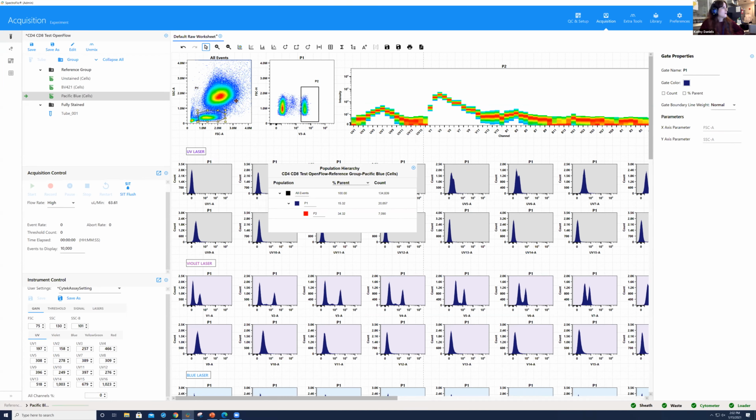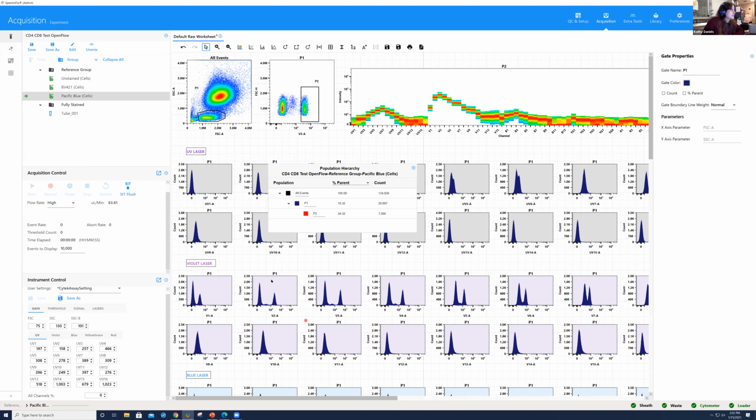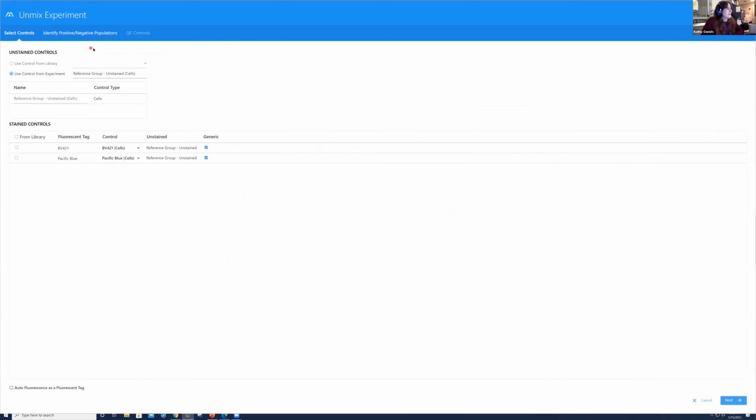Yep. Okay, great. So now that we've gone ahead and recorded these single colors for these two fluors that have a very similar spectral signature, what we're going to do is go ahead and unmix to see if it works. Okay. So we're going to click unmix. Let me go back and do that again in case I did it too quickly. So I'm hovering up here, right? And there's this unmix option. And if we click on that, we're using our controls from our experiment and not from the library. We use them freshly made up.